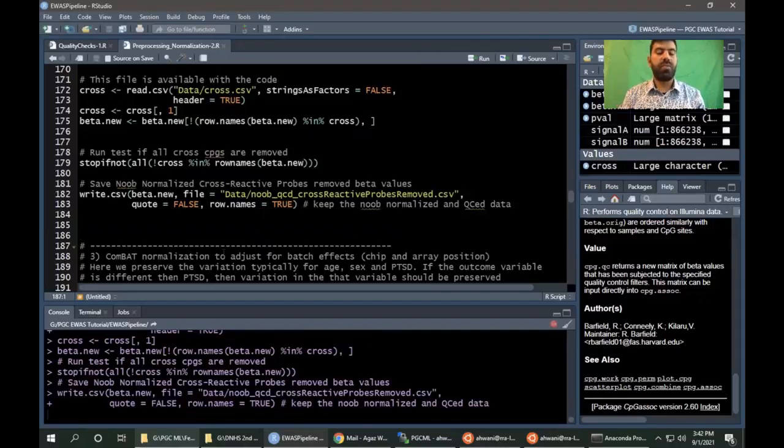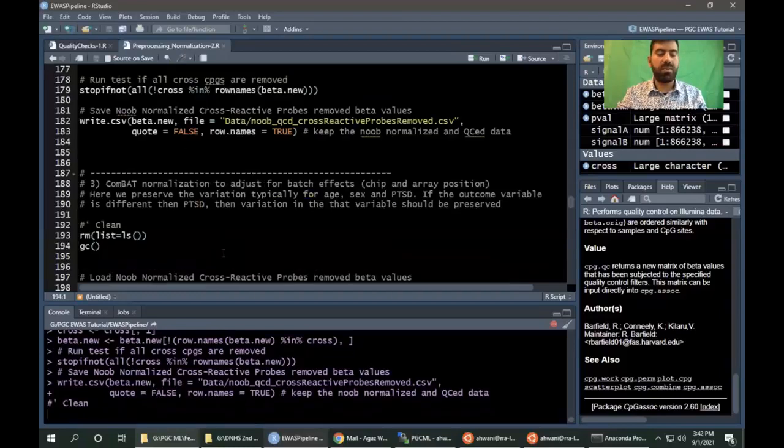The next step, a very important step we have to do, is ComBat adjustment. It will remove the batch effects that are in the data. But one main thing we have to keep in mind is that we have to preserve the variation for the phenotype of interest. For example, in this case it is PTSD. We also have to save it for sex and age. So we will build the matrix for that and use that matrix to preserve the variation in ComBat adjustment.